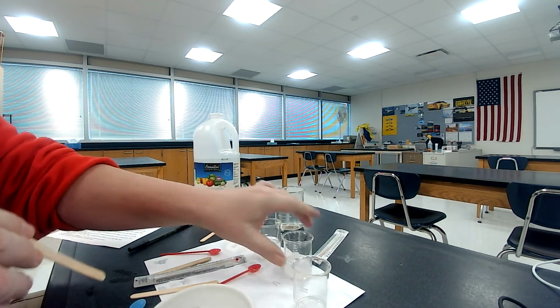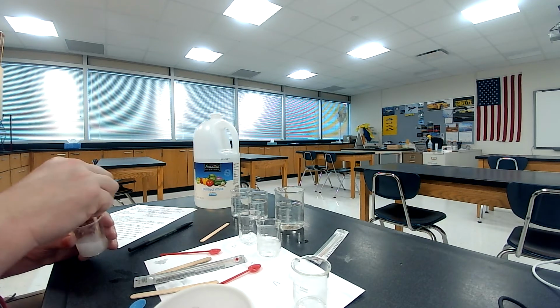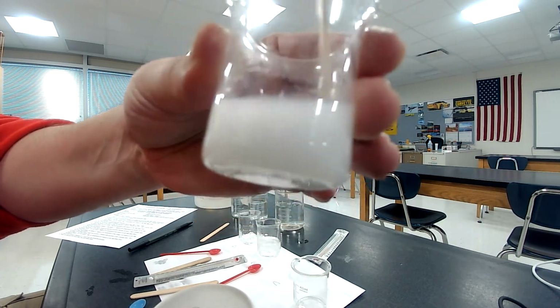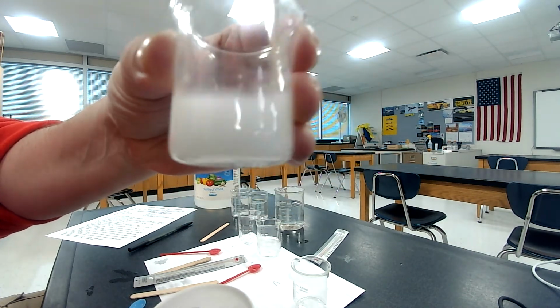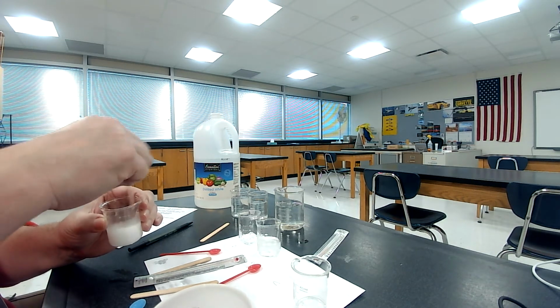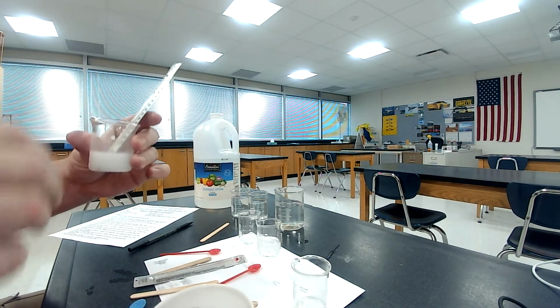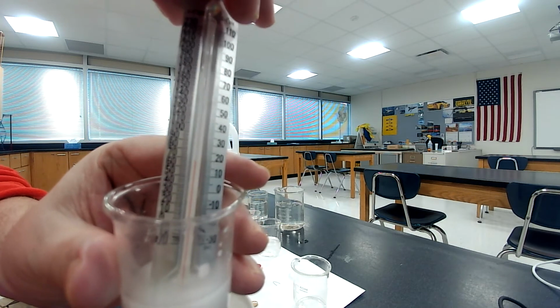And it says to stir it with a stirring rod, observe it for a minute. So you can see here I'm stirring. Look at this time. We got ourselves a little bit more. It seems like you can't see through the solution very much. There's really not too many chunks on the bottom. Okay, we'll keep stirring here for a little bit. And it says measure the temperature and record it in the data table. So I might as well get my thermometer in there. Okay, you can see the bulb is covered. Okay, you can see here roughly.